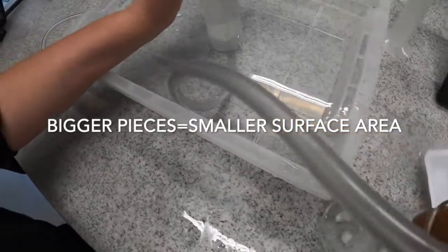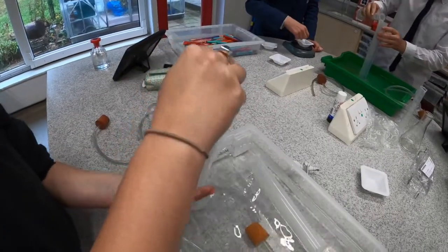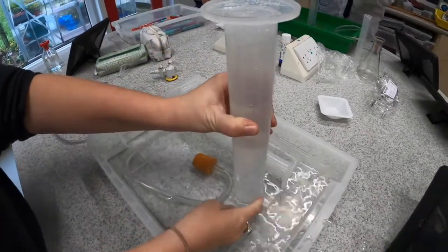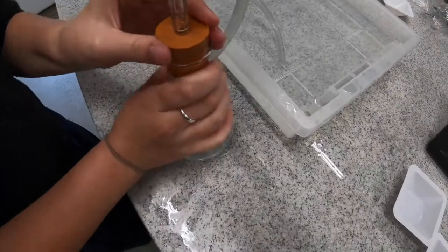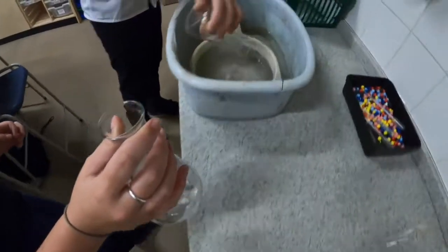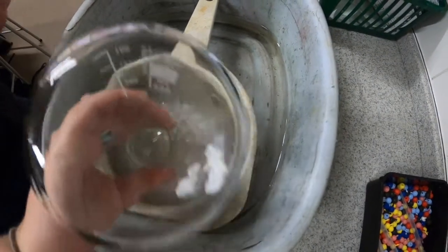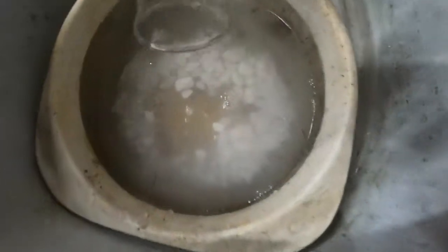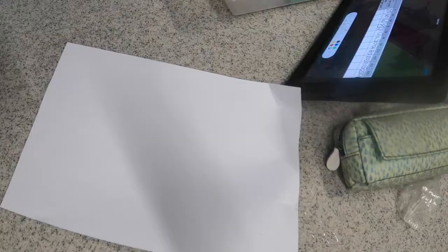Then we use bigger pieces, same mass of calcium carbonate or marble chips, and we're going to have the same reaction, same concentration of acid, and we're going to see how much carbon dioxide that produces in the same amount of time, 5 minutes. So you can see that the limiting factor on that one was the amount of acid, because the marble chips are in excess.